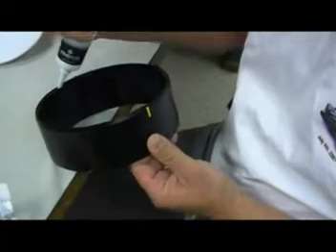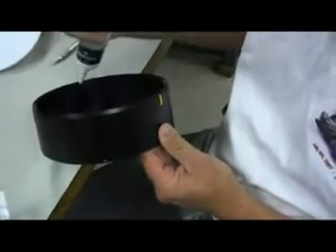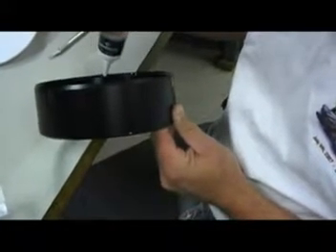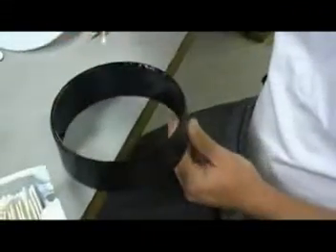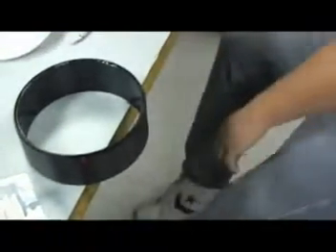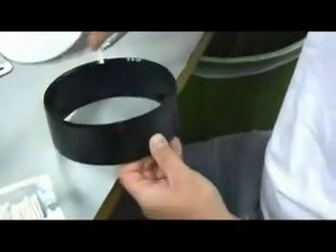The idea here isn't to be neat at this point. The idea right now is to make sure that we completely fill that groove where the polycarbonate disc is going to sit. For this step, I would get an entire box of Q-tips. We're probably going to use about 50 of them at least.